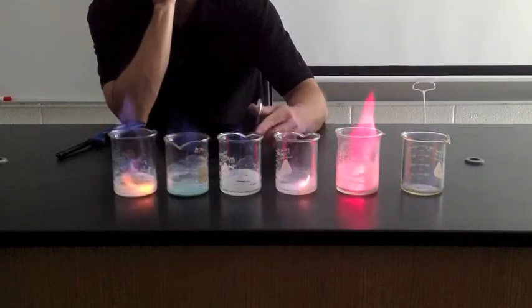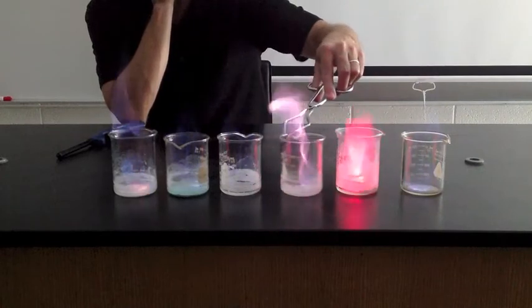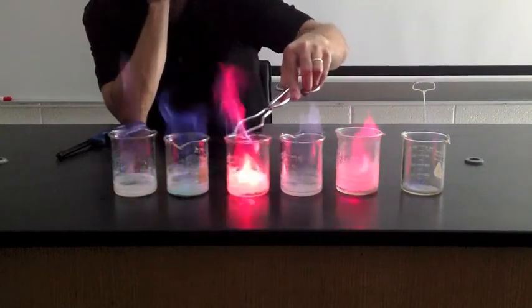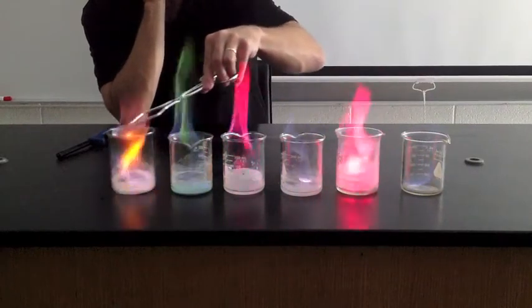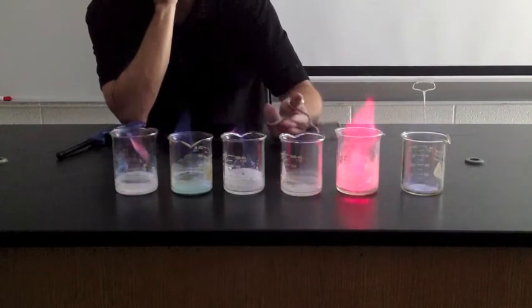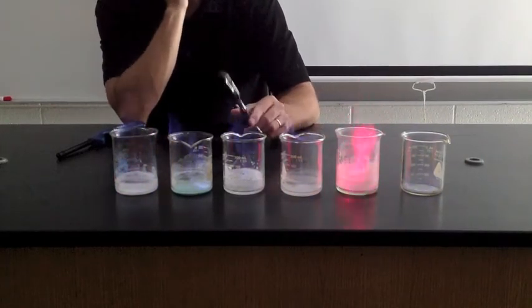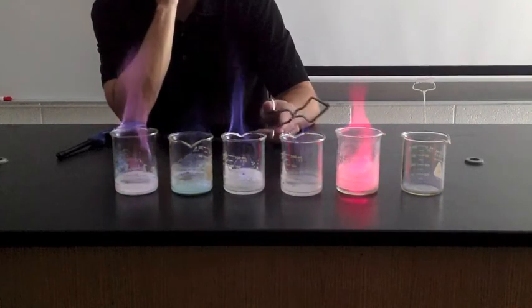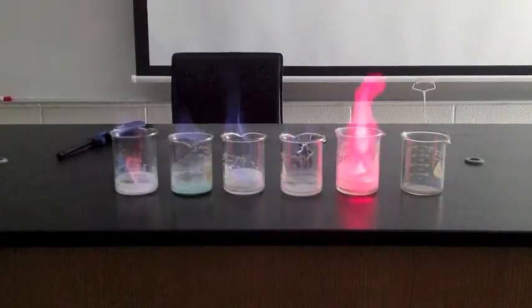You see that wavelength as a color, your eye does. But just basic flame test, it's a good qualitative way to identify the compounds, the metal ions that may be inside of a compound. All right, the flame demo.